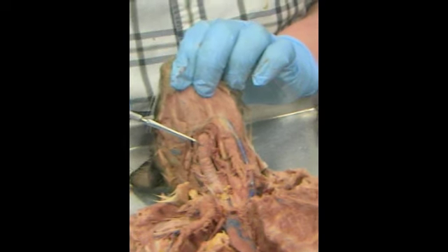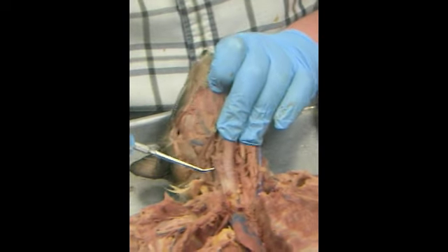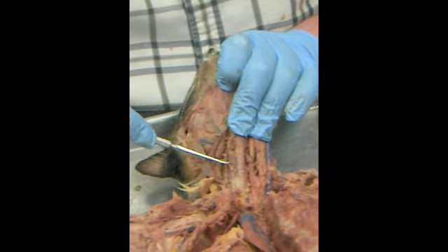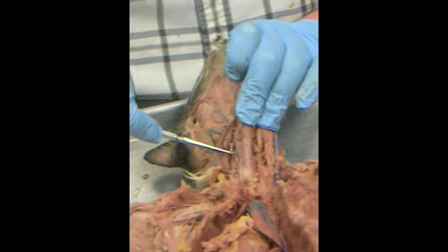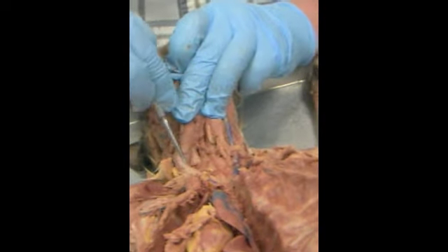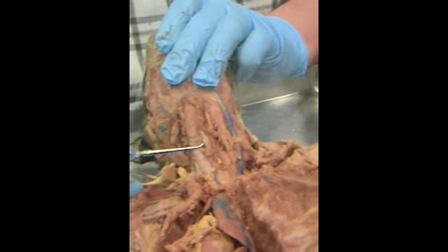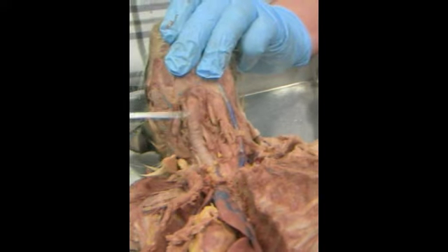That's the cricoid cartilage. This tube coming down is his trachea. Off to the side right here, this little bean, that is his thyroid gland. Behind the trachea is a small, flat, brown or light gray tube. That's the esophagus. Okay? So now we're down into this cavity.